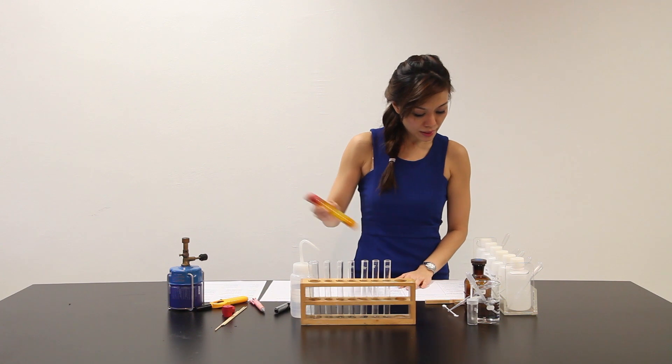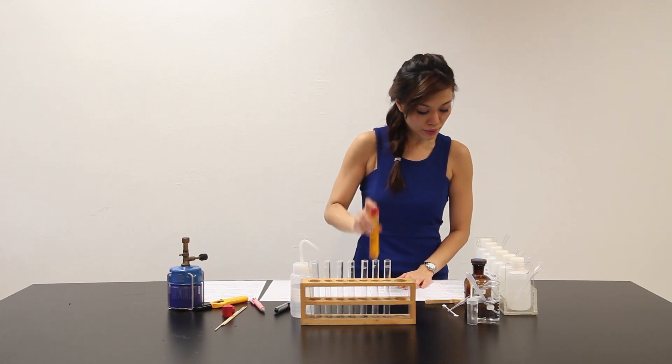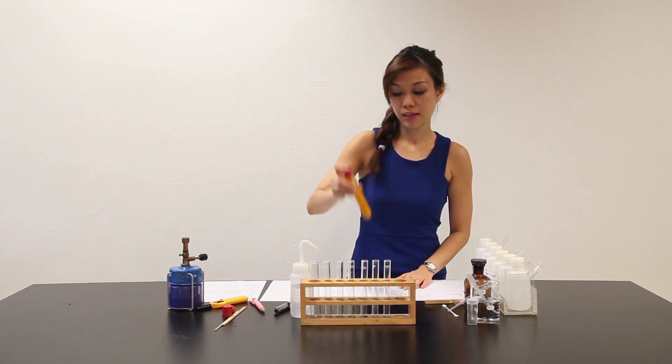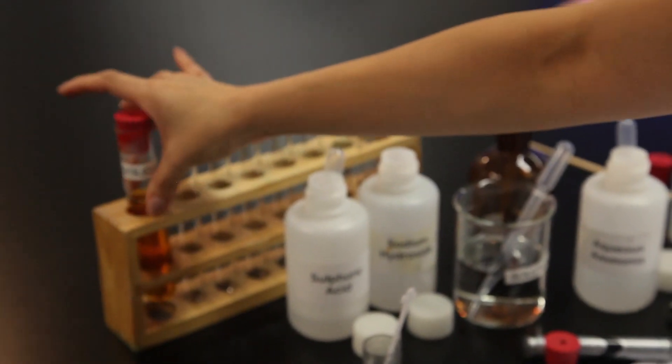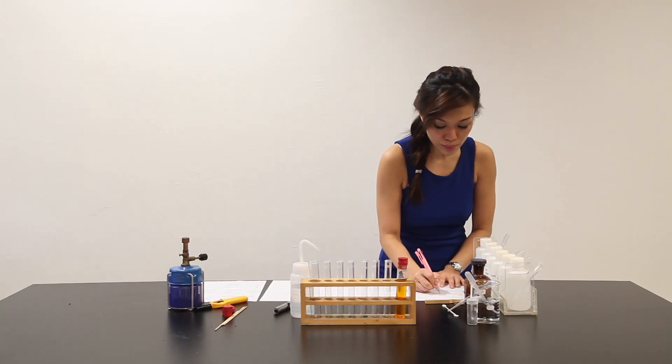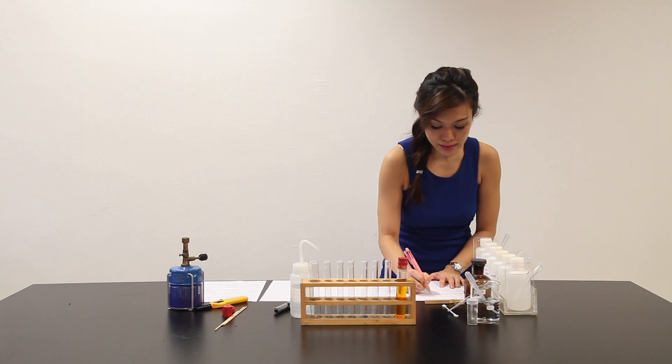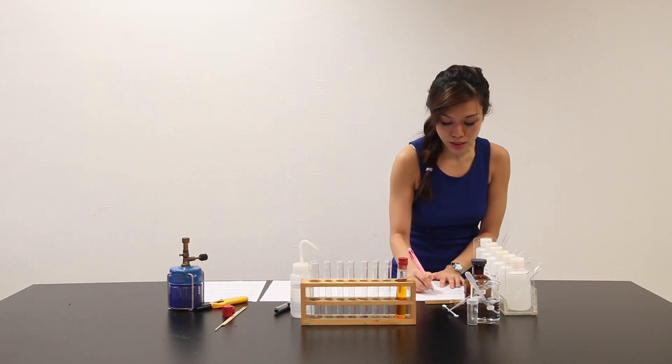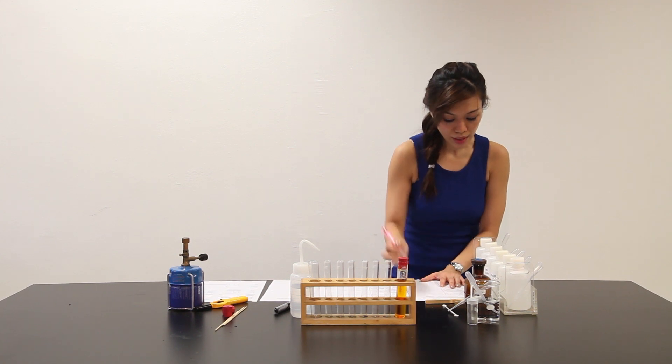Stopper it. Shake the test tube thoroughly. Solid X dissolves, giving a clear solution. Let me write down this observation. First, solid X dissolves, giving an orange solution. Let's move on.